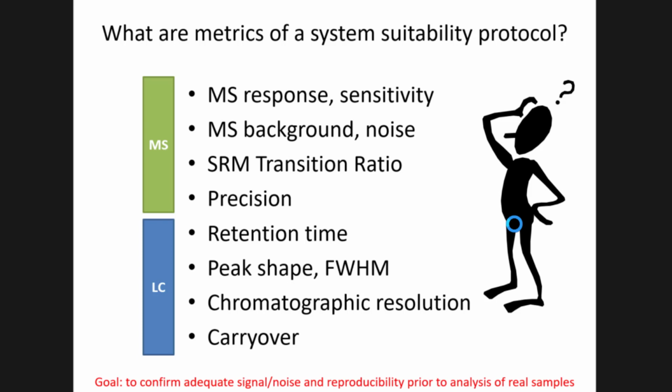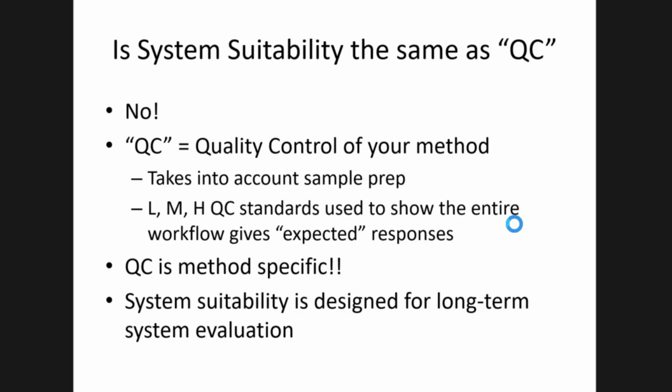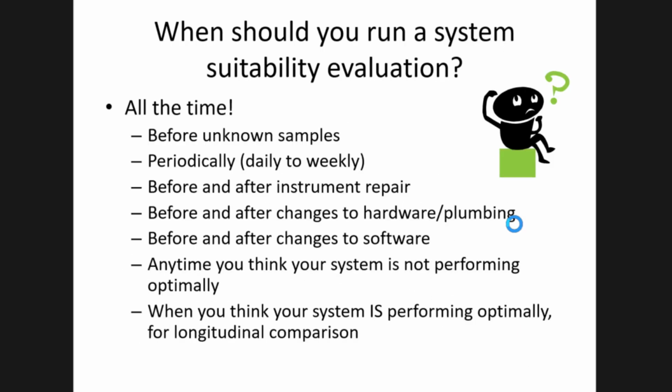Some analytes will have tailing, right? Or if you have isoforms of a certain form of a peptide, you might see a humpy, not well-defined peak, and that happens sometimes. But the majority of the time, you should have nice Gaussian-shaped peaks. In the previous example, this was just bad fitting, which caused post-column band broadening. And so that's not normal. That's something that can be fixed.